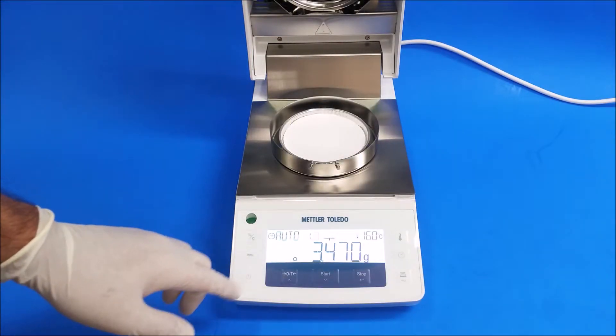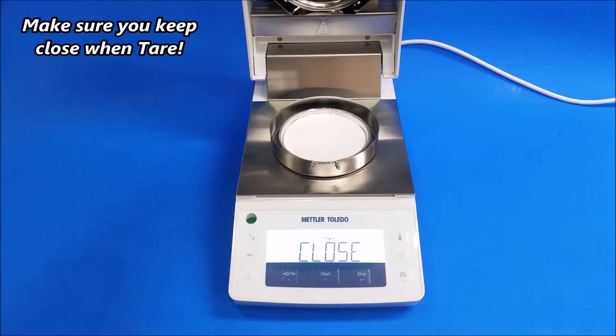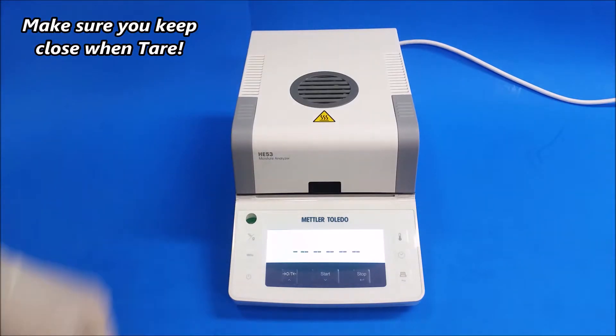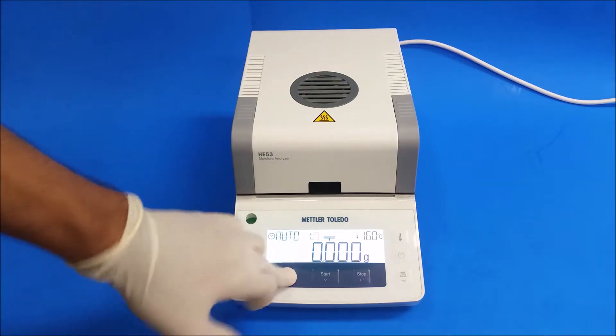I'm going to show you what happens when you don't. When you press tare while it's open like this, it's requiring you to close it. Once you close it, it tares. And if you want to tare, make sure it's closed. Just press tare here again.